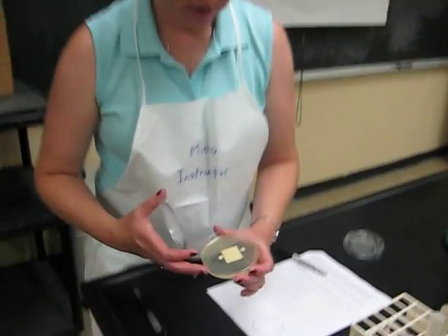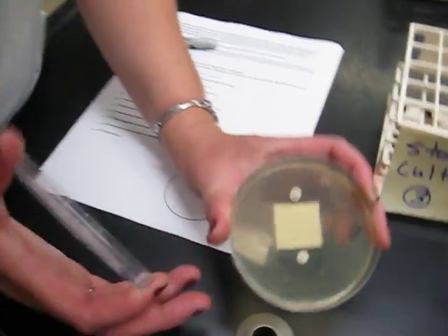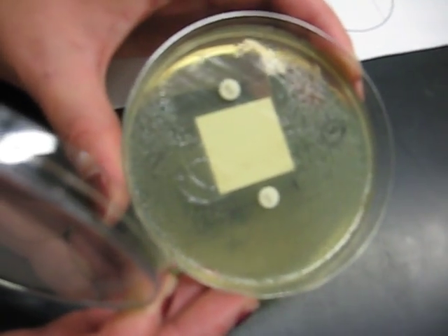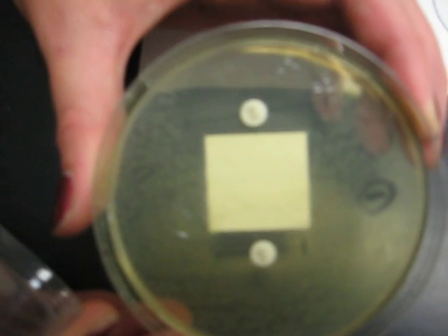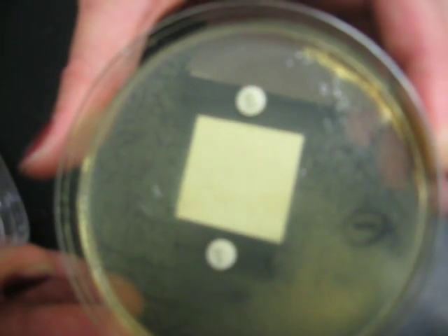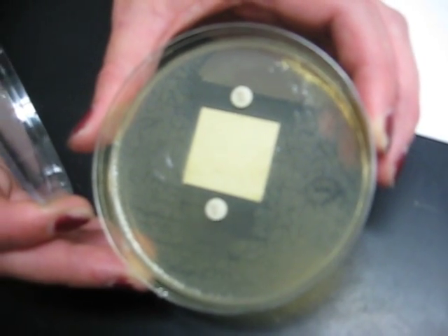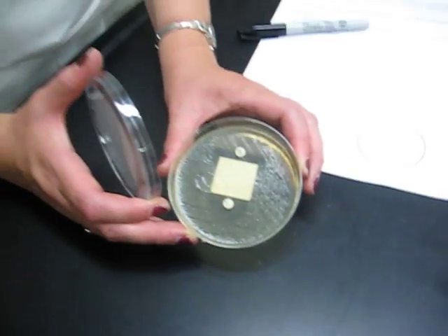I don't know if you can see those. Is it better on the black of this? Black. All right. This isn't streak plate. This is just spread out bacteria, but you can see there's little circles on here. Hopefully ours will be more spread out. Those little circles would be isolated colonies if they arose from just a single bacteria or two bacteria of the same species. So we call it pure culture.